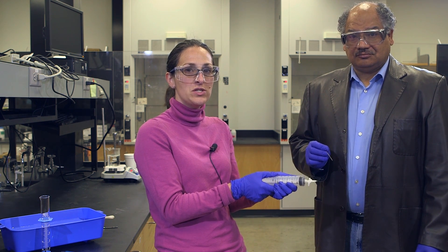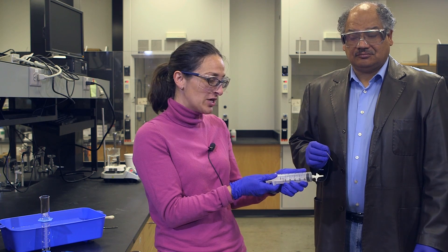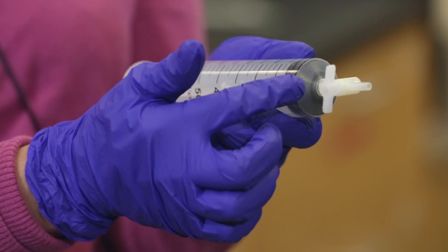For Experiment 4, we're going to be measuring the volume and the mass of some trapped gases. In order to do this, we need to have the mass of our empty syringe with the nail in the nail stop. For this part, you're going to need your plastic 60ml syringe with a stopcock.